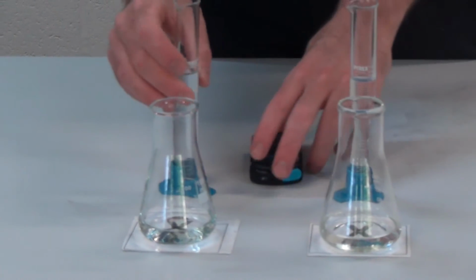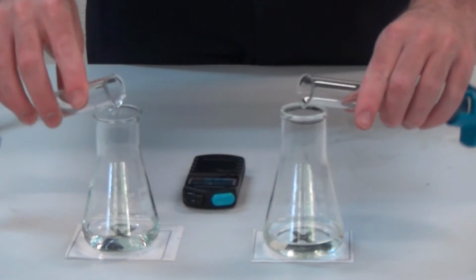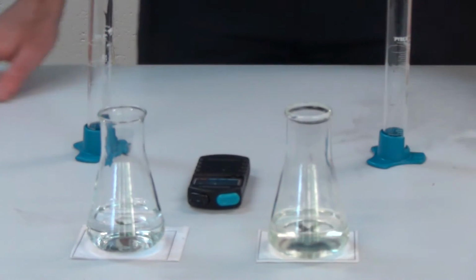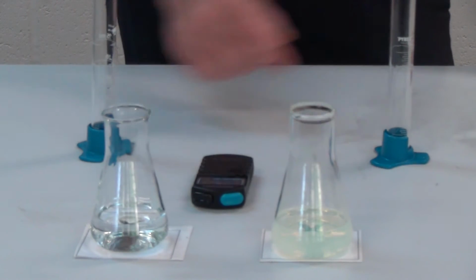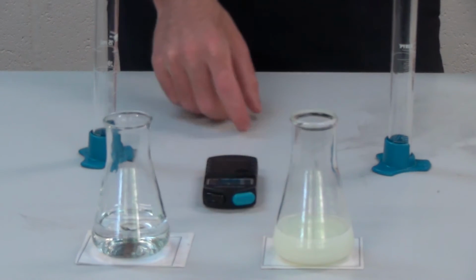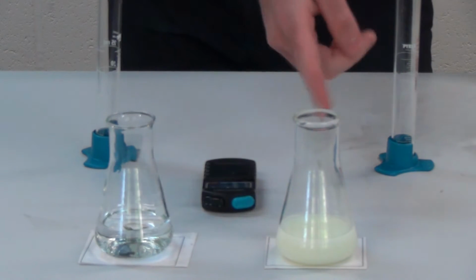Okay. Now if you tighten it up again, the camera will roll over. Good. Alright, so I'm getting ready to add these in, and I'm going to hit my stopwatch and pour them in. Remember, this one was really concentrated and I can't see the cross anymore. So I'm going to lap that at 11 seconds. I'm going to keep this one going. So I would write down for that one it was 11 seconds.